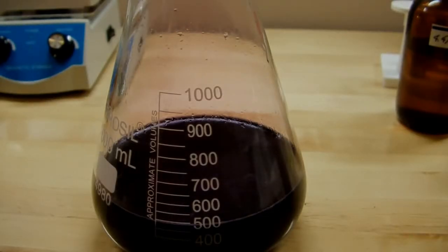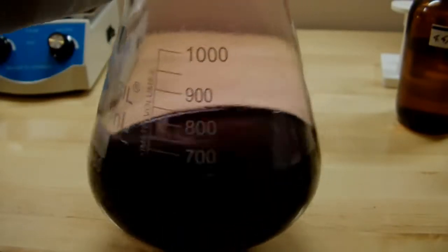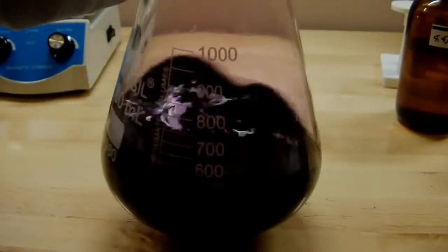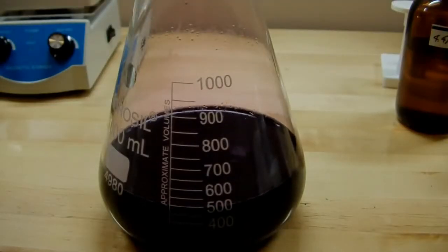Also notice that when I add the thiosulfate, it bubbles a bit. So you have to be really careful, actually, when you're neutralizing this, because it can froth significantly. I've seen this. It gets really mad when you try to neutralize it. So it's bubbled quite a bit on a couple of occasions, and it heats up a lot. So you have to do it pretty slowly, so that it doesn't get away from you.